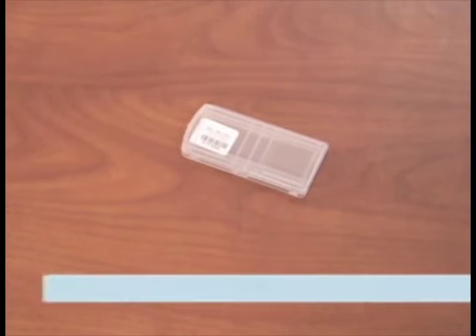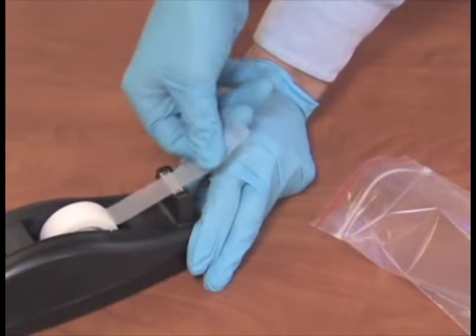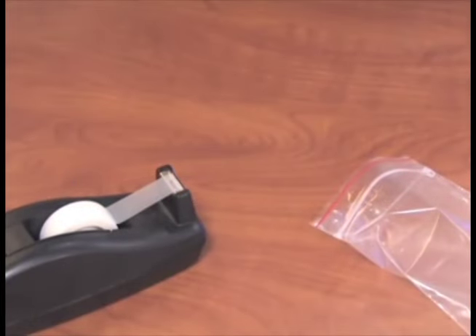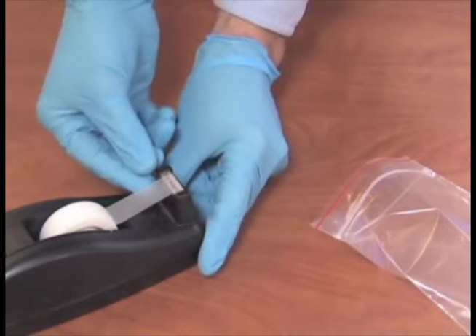7. Close the container and label it with a unique identifier, such as the sampling location and the date. Alternatively, transparent adhesive tape can also be used if biotape is not available in the field.